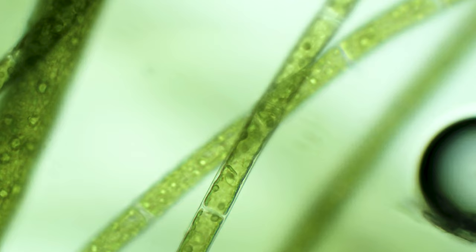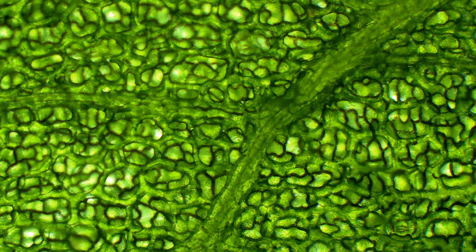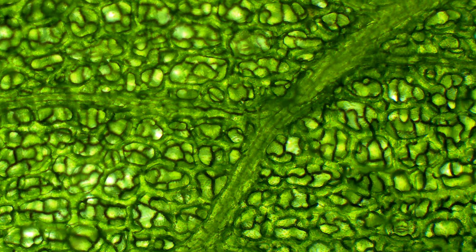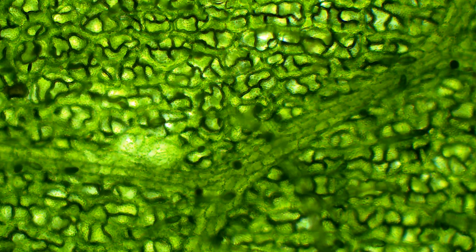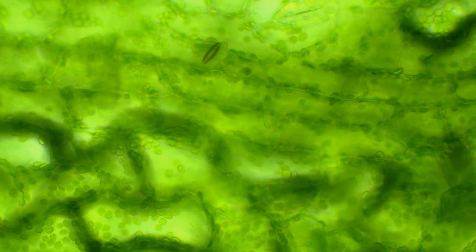Let's move on to a bit more advanced organisms: leaves of real plants. We can see that they consist of cells stacked next to each other, a bit like a puzzle. If you look closer, you can recognize individual chloroplasts inside all of the plant cells — these are responsible for the whole process of photosynthesis.